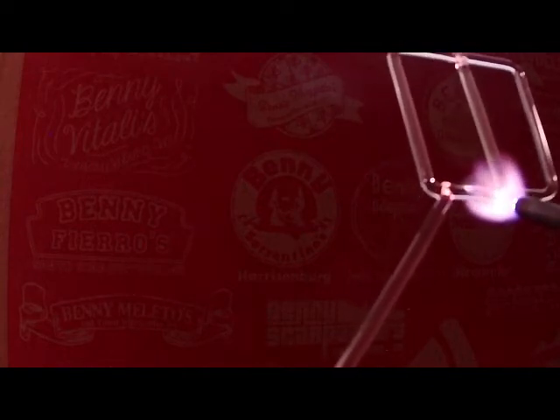So now what have I accomplished? Well, I've actually made two very bad welds. In other words, if I stopped right now, which is very tempting, this weld and this weld are not very good, not very uniform. But that's okay, because I just wanted to get the glass fused in those two positions. And so now I'm going to come back and heat it very strongly to finish the weld.